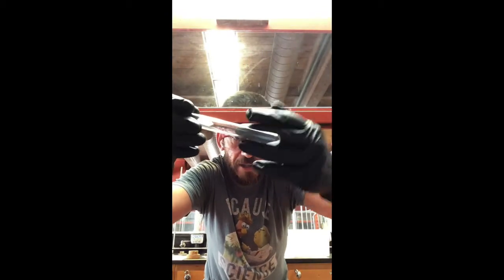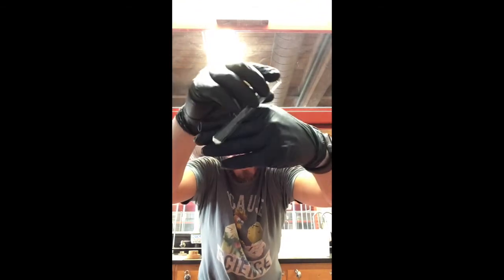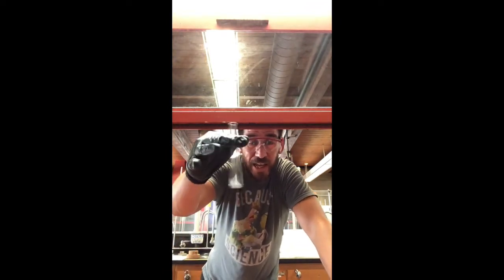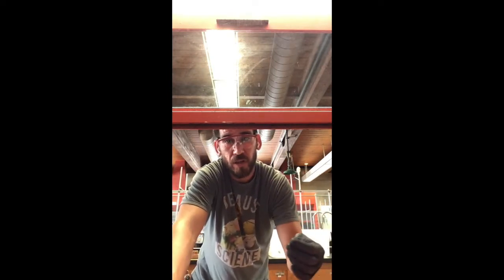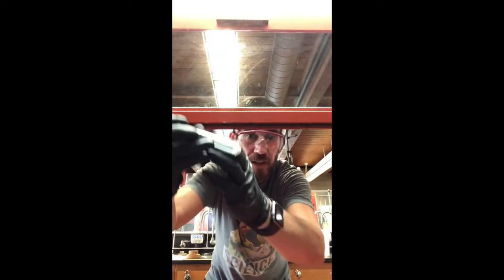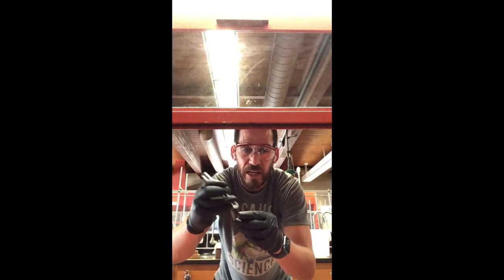It flows like sand. It does not clump. You can see it just bouncing around, free flowing. When it's in the liquid, I call that snow globing, because when you give it a little shake, it swirls around, free-flowing particles, like individual granules, as it is in here. So you want to take a close look at this in real life and see if you have any small particles like this that remain in your methylene chloride, okay?